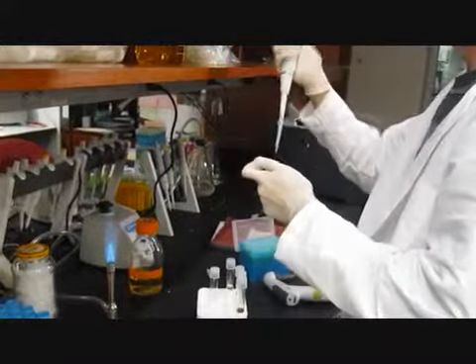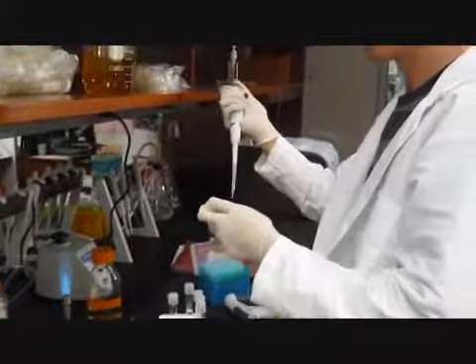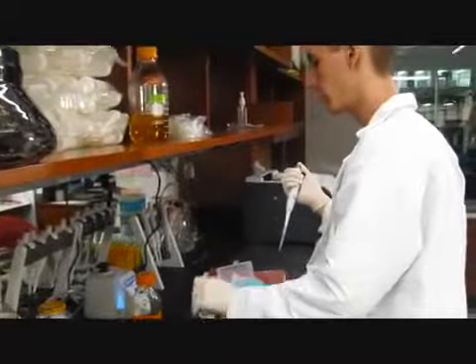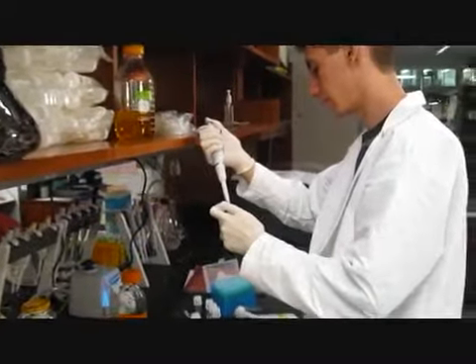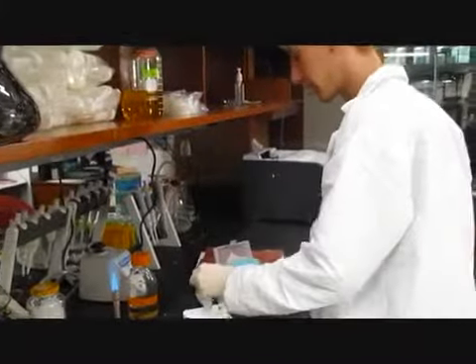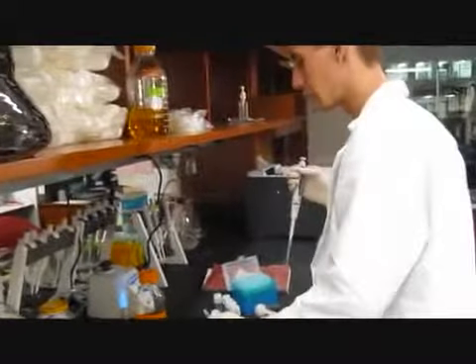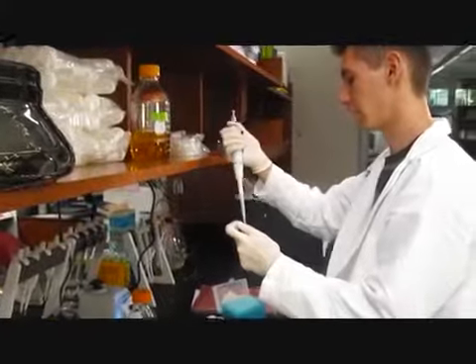And then on Sunday, the last day, we'll count colonies, and hopefully almost all of these will have no colonies or just very few, because I don't want to count like 780 colonies for 6 plates, you know? It's going to suck. And because I have to write all this too, it's homework, you know? Can't just be here all day.